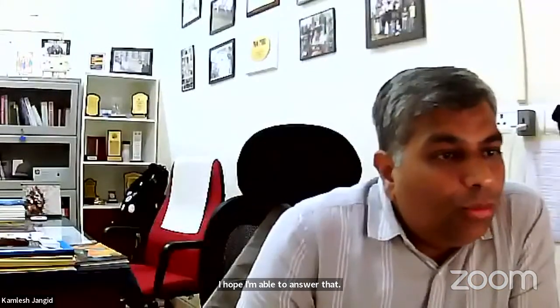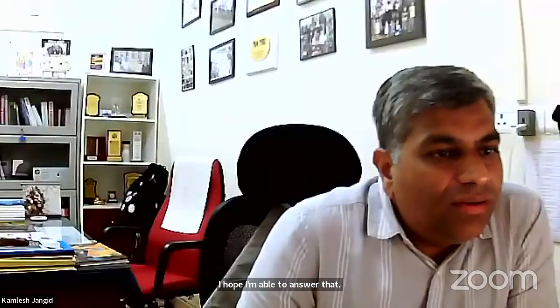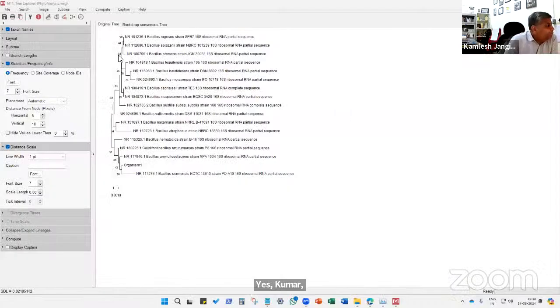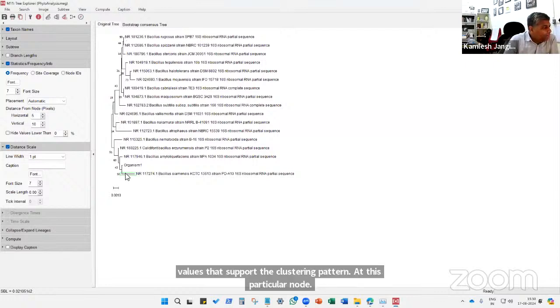Kumar has asked, sir, what are the values on the left side in the phylogenetic tree and what do they indicate? So yes, Kumar, let me share the screen again. The values on the left are bootstrap values that support the clustering pattern at this particular node.